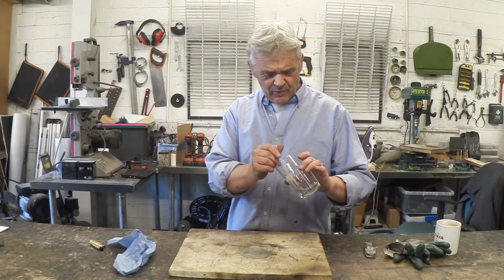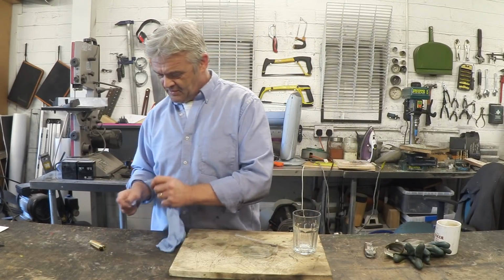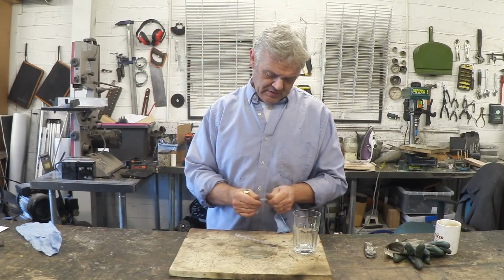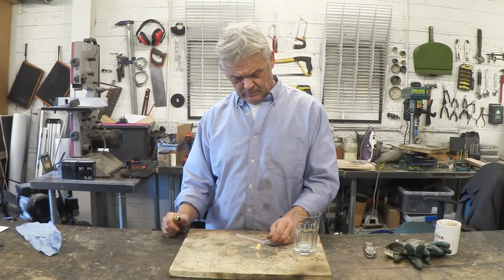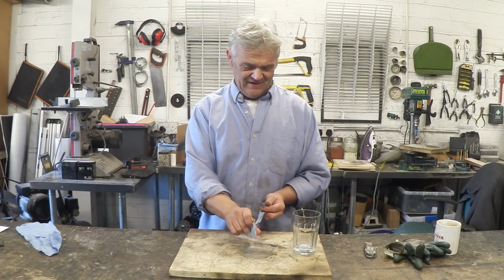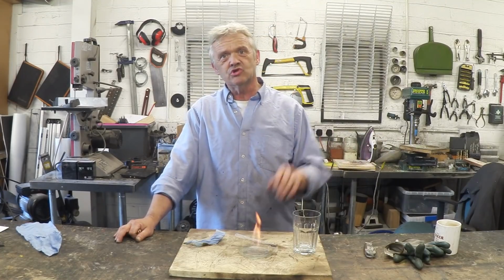So here's the stuff that we actually produced. If I put a little bit in there, get myself a bit of a spill. And there we go. We now have an alcohol flame. And just to show you the flame, there you go. No worries at all. So we've made ourselves a biofuel, and we can use the still to do that.